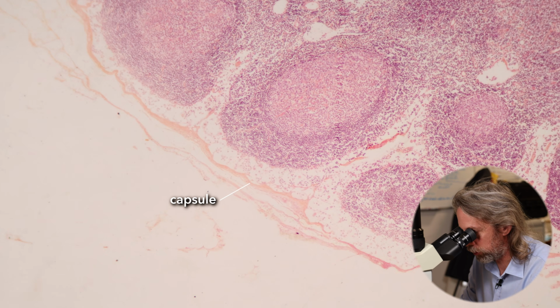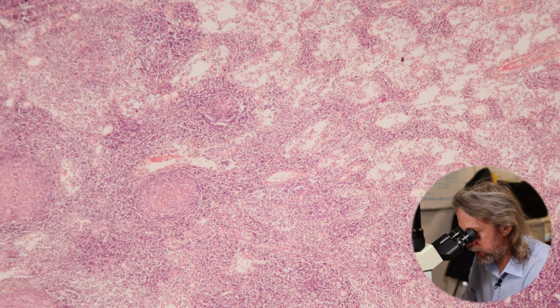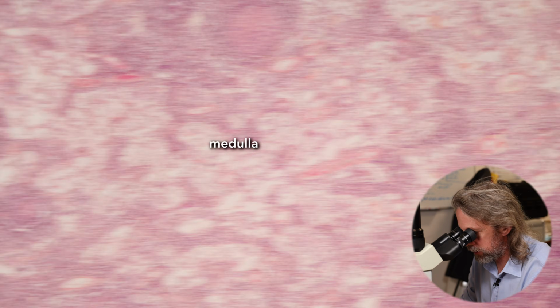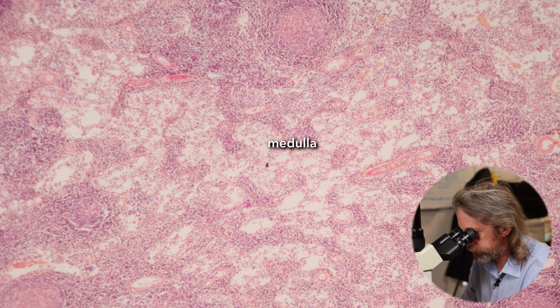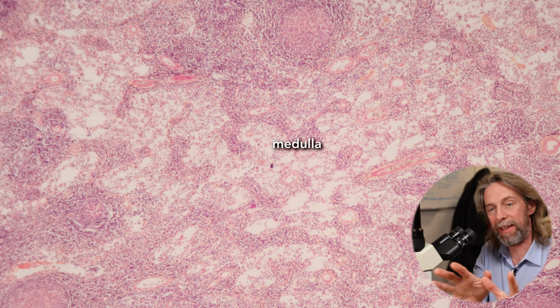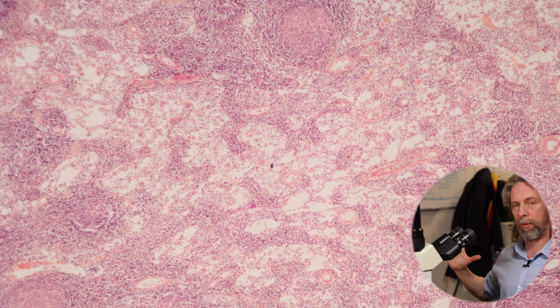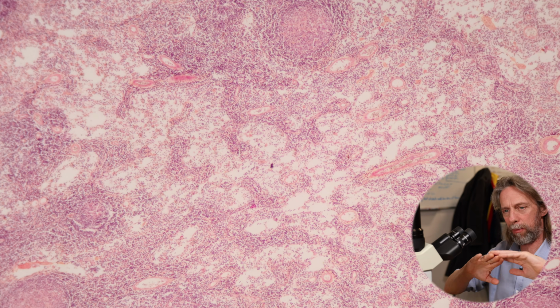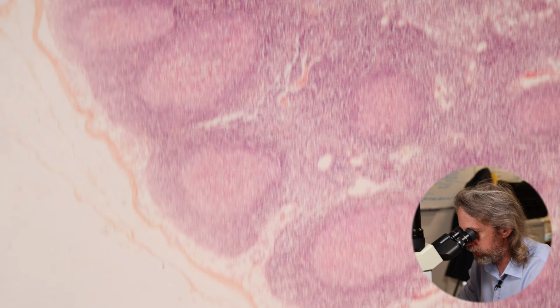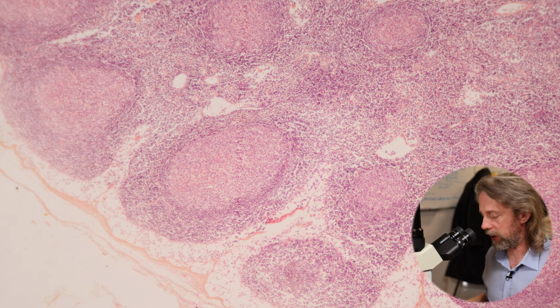We're seeing the capsule, and then the fluid will pass through the lymph node into the medulla, and we can see some structures in there, some tubes, which we'll talk about, but we will only see the vessels that are leaving the lymph node if we had a section that was going through the hilum of the lymph node. But the flow is from the periphery, the outside, into the middle of the lymph node and then out through some other vessels.